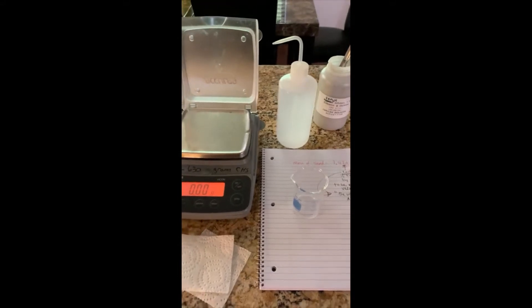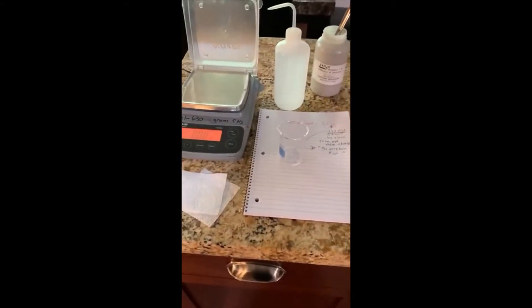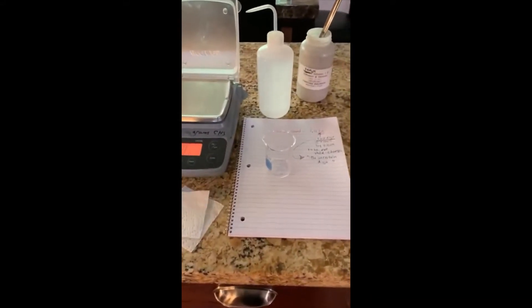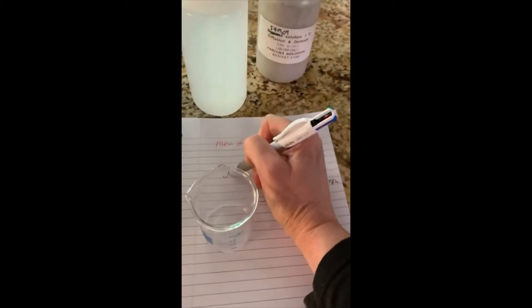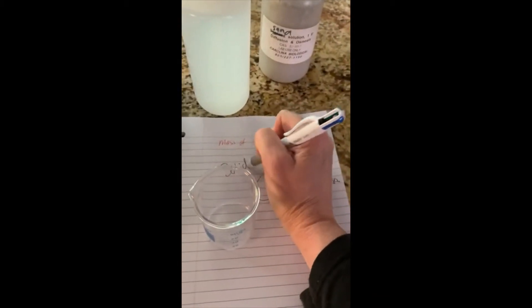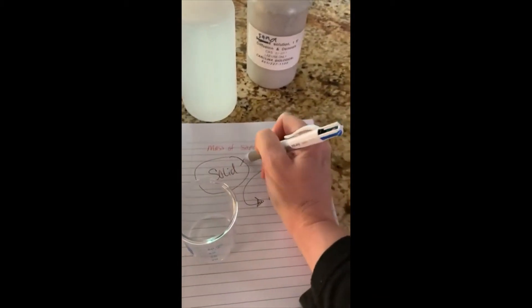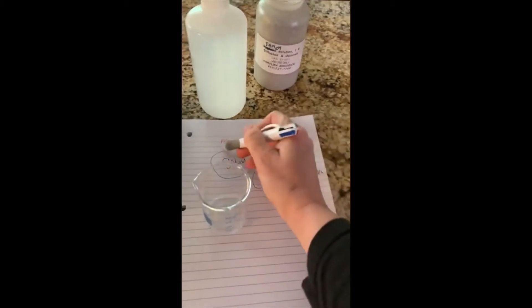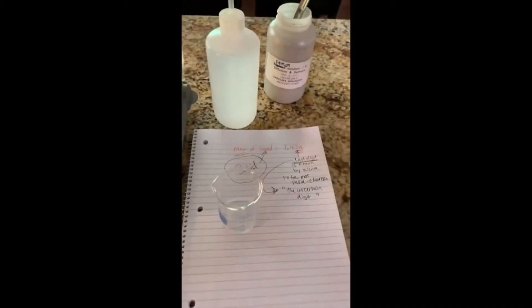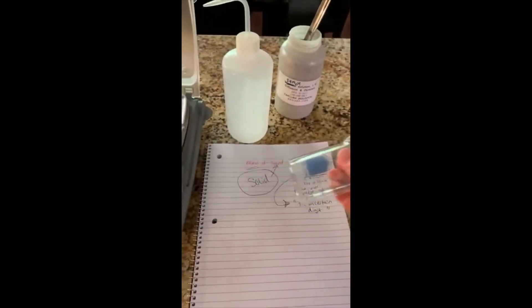Students, so now we want to figure out how to use this same scale but with liquid. What we just did was solids — sand is a solid — so we just finished the mass of the solid. Now what if we have a liquid?